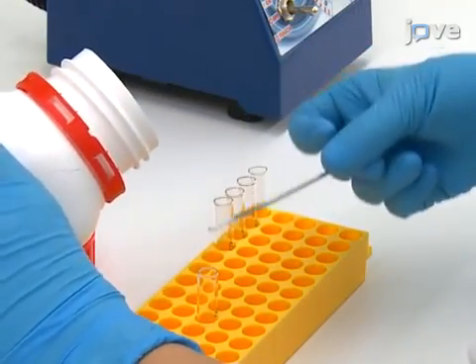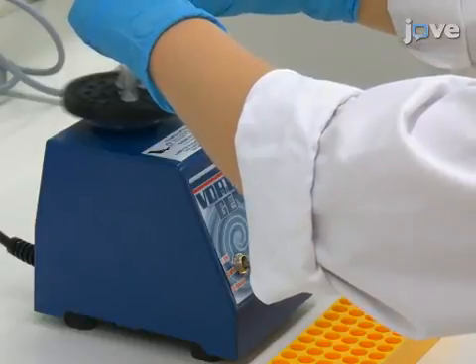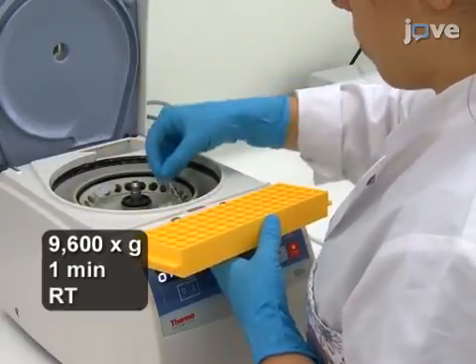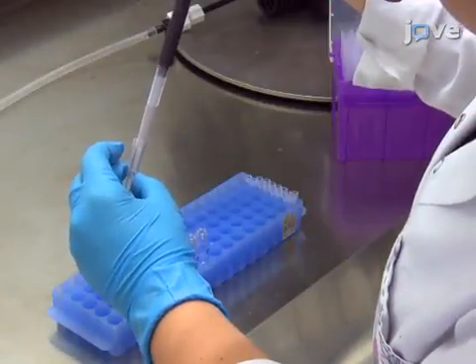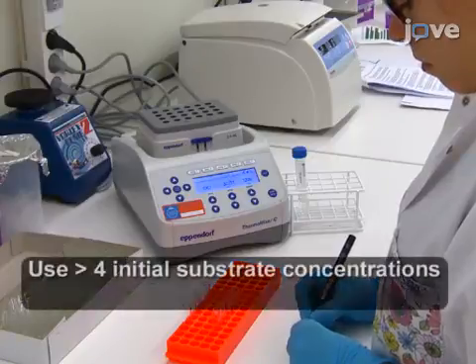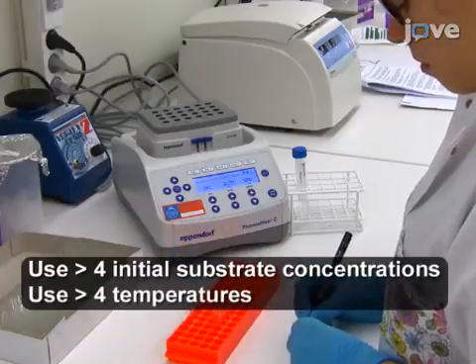Dry the extracted reaction mixtures with sodium sulfate. Vortex for 5 seconds, and let the tubes rest for 10 minutes. Perform a final centrifugation step at 9,600 g for 1 minute at room temperature using a tabletop centrifuge. Then, transfer the extracted samples to gas chromatography, or GC, vials. Repeat the procedure for each enzyme variant of interest, using at least 4 different initial concentrations of the substrate for single substrate kinetics, and 4 different temperatures for both single substrate and competitive kinetics.